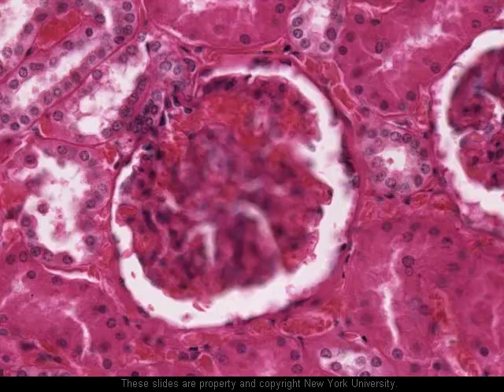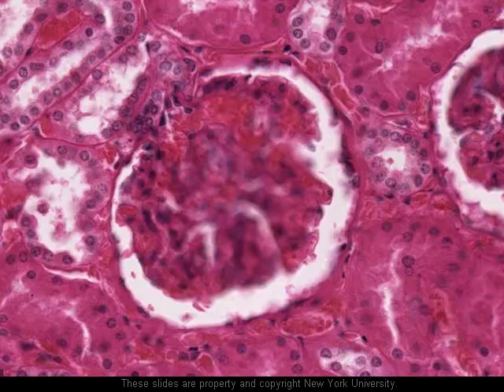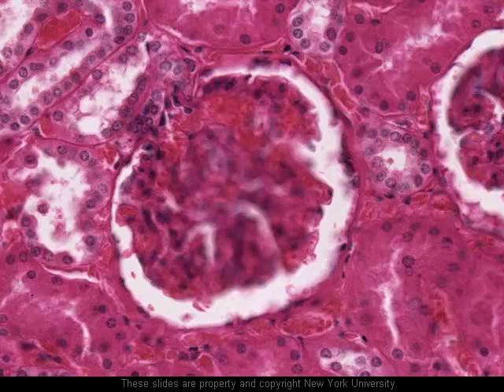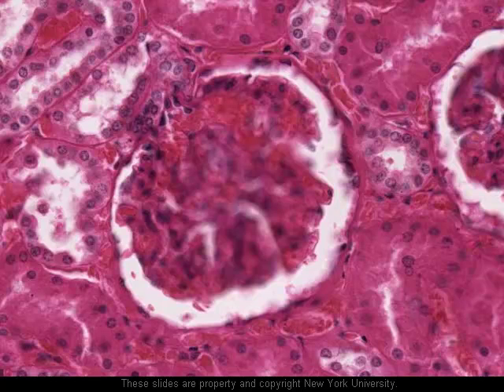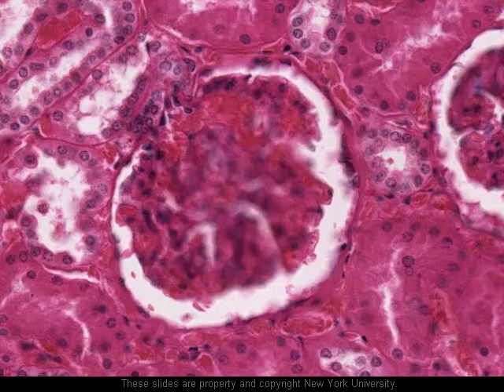The space that surrounds the glomerular capillaries and the visceral layer is the urinary space into which urinary filtrate is secreted. The lining of this Bowman's capsule is the parietal layer of Bowman's capsule, and it's made of a simple squamous epithelium. We can see the nuclei of some of these simple squamous cells just here.